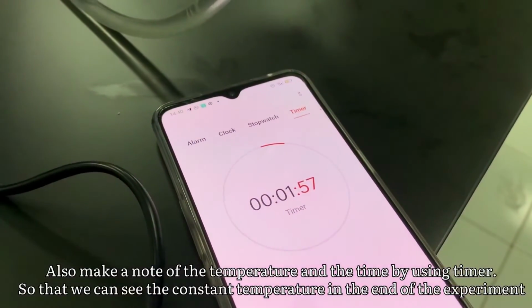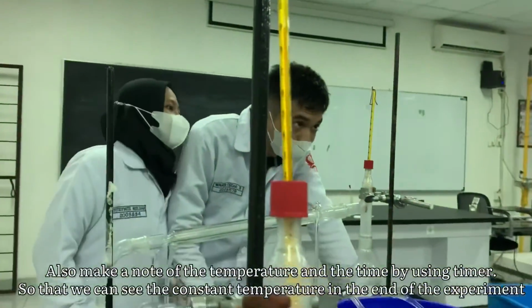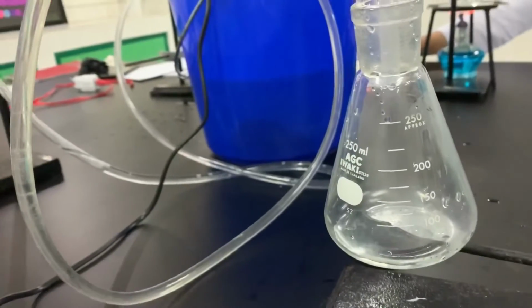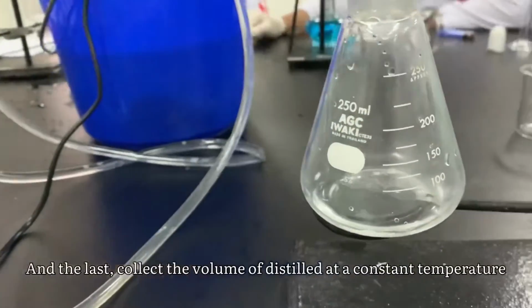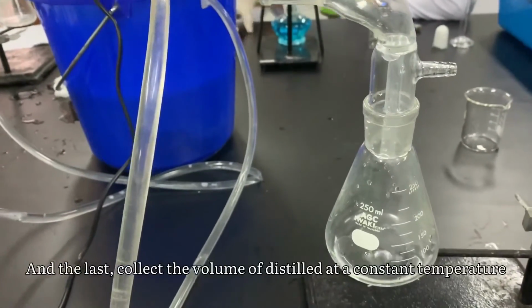Also make a note of the temperature and the time by using a timer so that we can see the constant temperature. And last, collect the volume of distillate at a constant temperature.